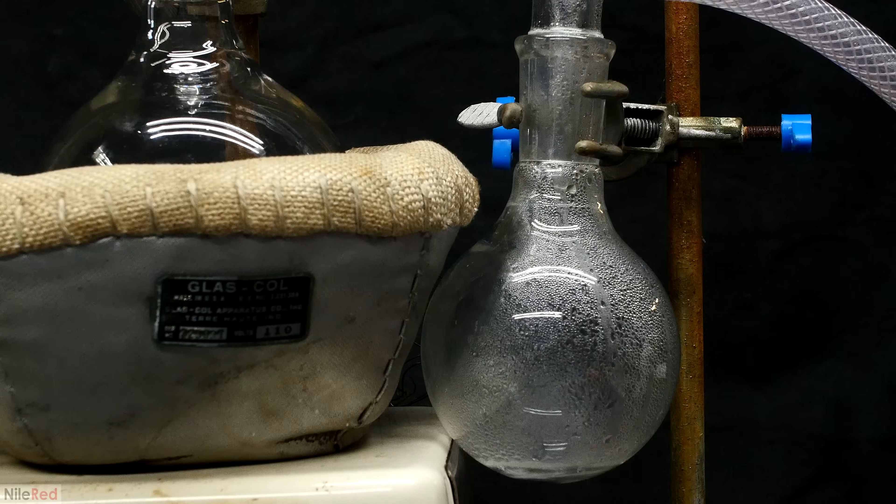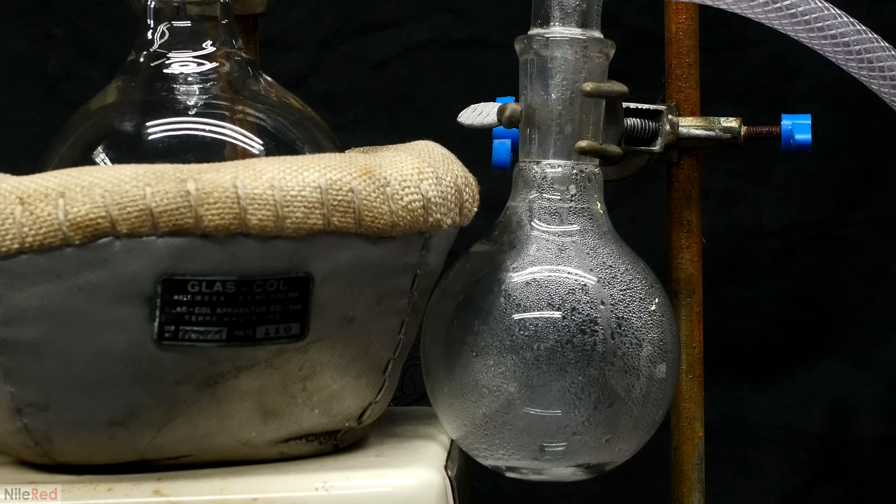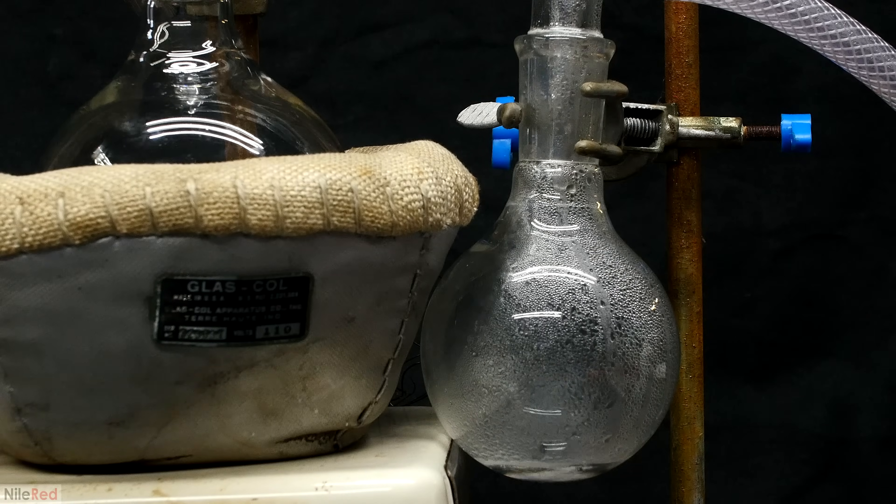The heating mantle was occasionally adjusted to maintain a good rate of distillation, but for the most part, we're on autopilot.